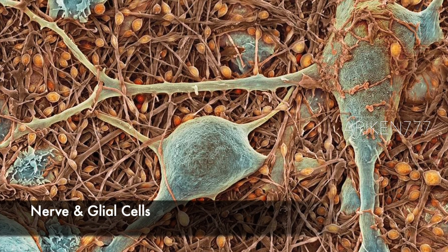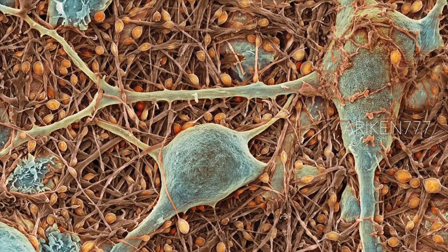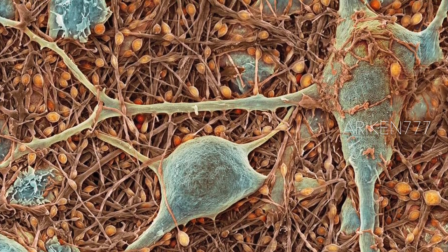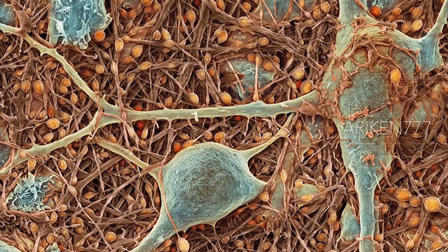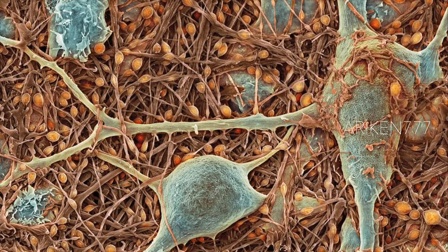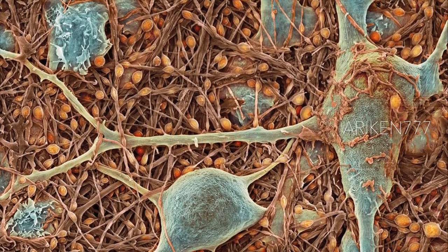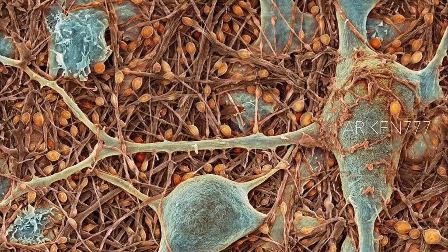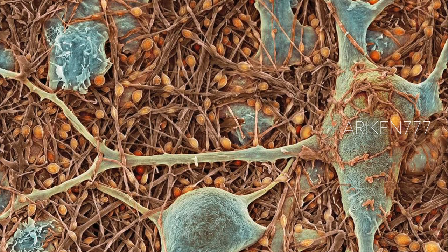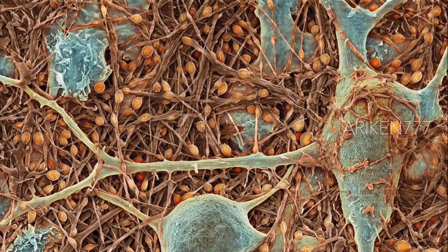Nerve cells and glial cells. The nerve cells have small cell bodies seen in orange color and fine extensions called axons and dendrites seen in brown. The glial cells have large cell bodies seen in blue with thicker extensions seen in pale green. Neurons are responsible for passing information around the central nervous system and from the central nervous system to the rest of the body. Glial cells are nervous system cells that provide the neurons with structural support and protection.